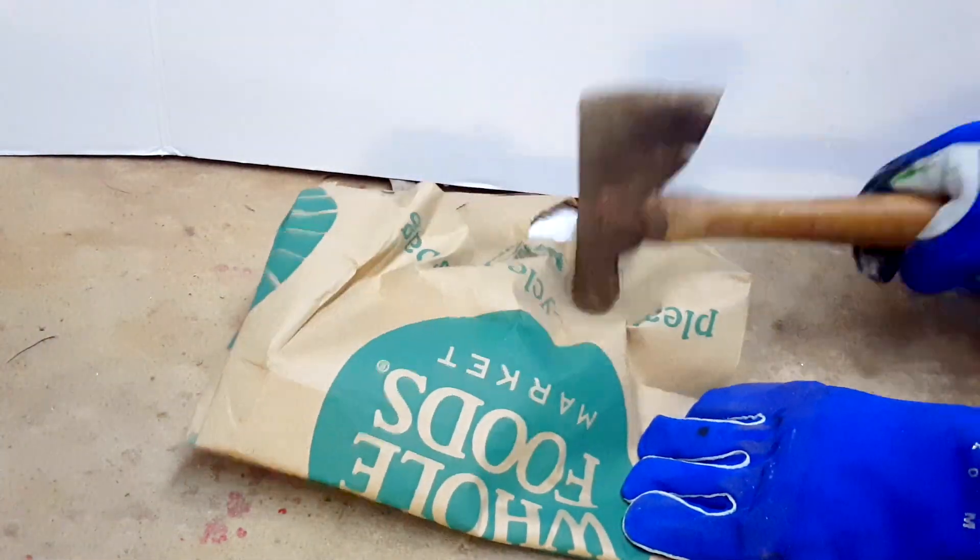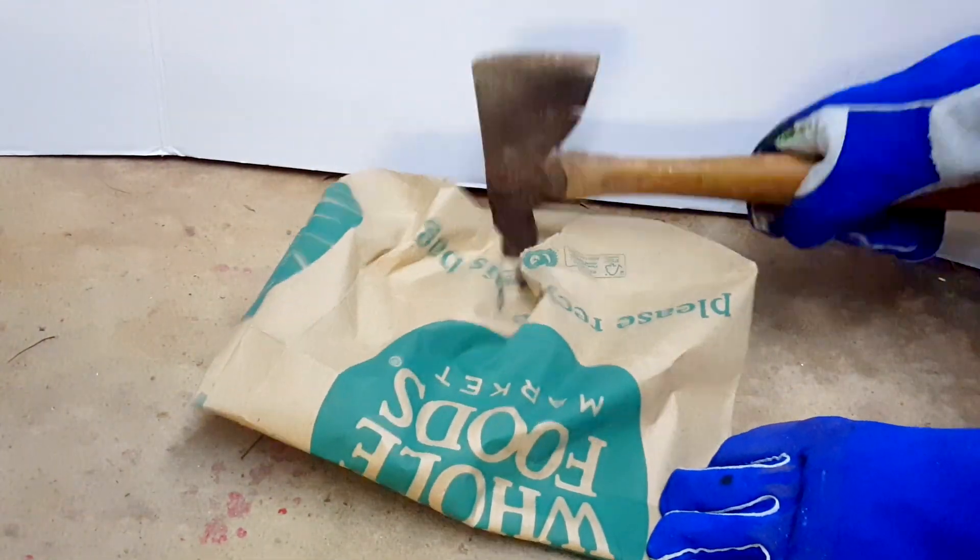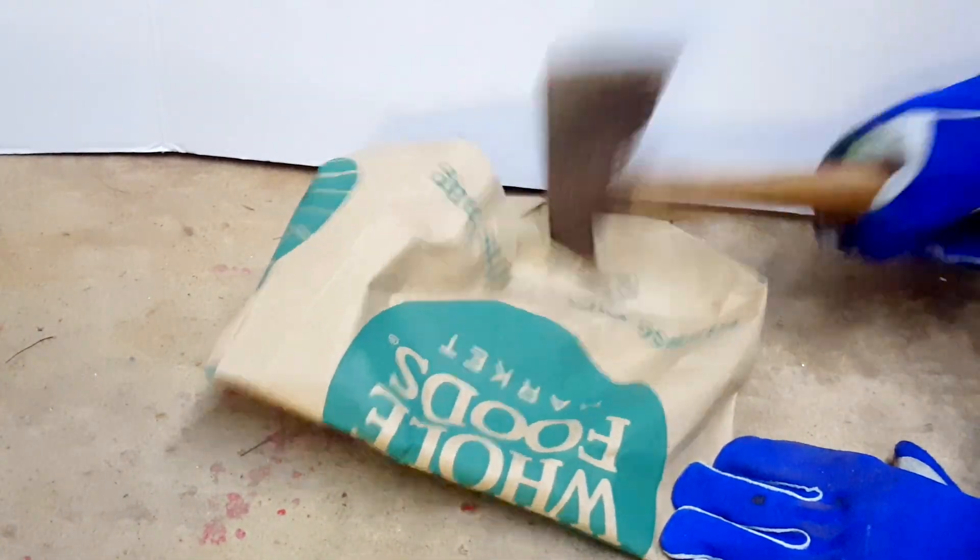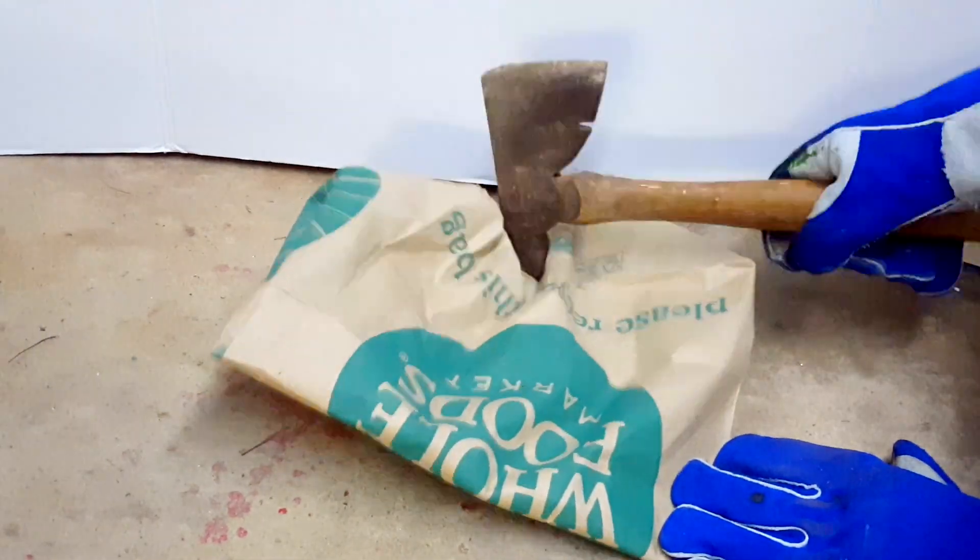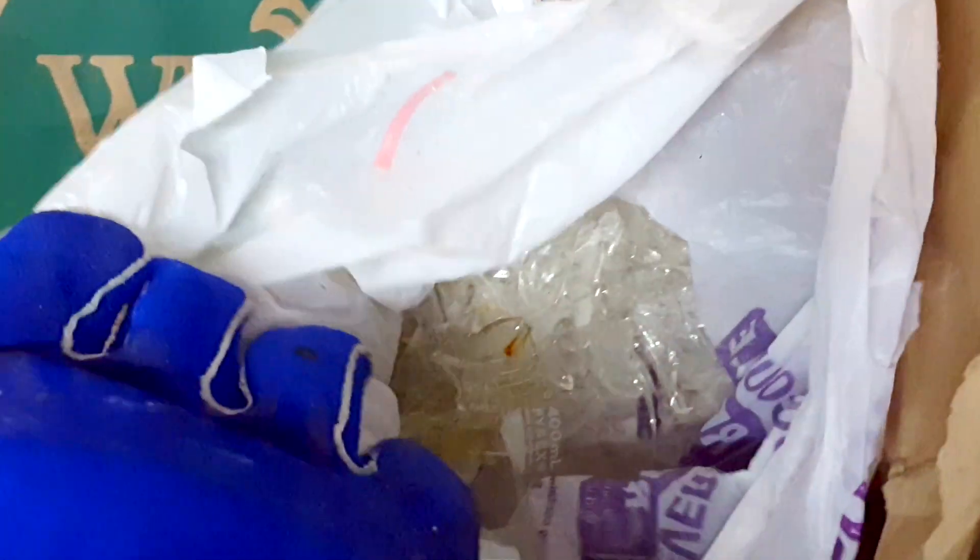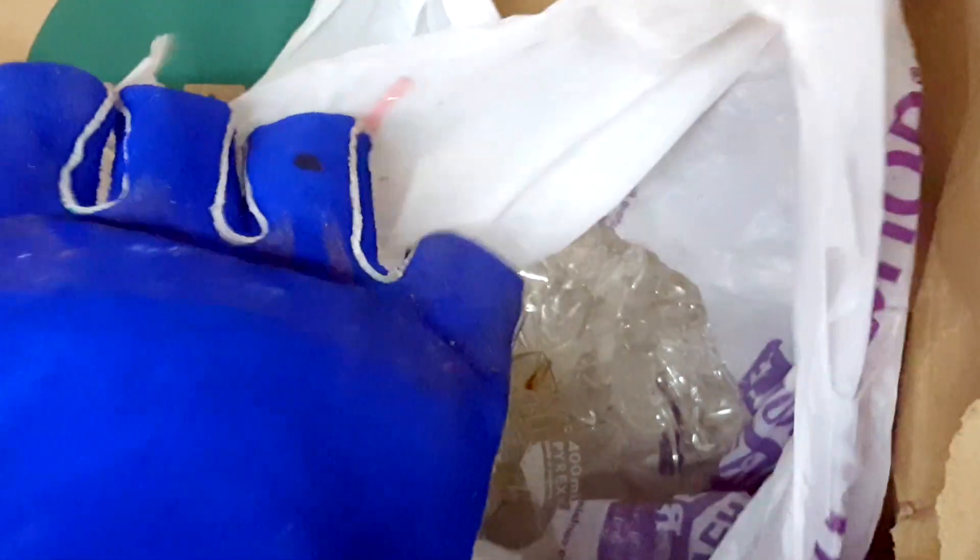I just moved it to the floor and started whacking. Note that the paper bag, if you use one, may rip some. That was the purpose of the plastic bag within it, to contain everything just in case it spills outwards. After breaking up the glass for a while, I opened up the bag, and this is what we're left with. This is about the right size that you should stop and move on.